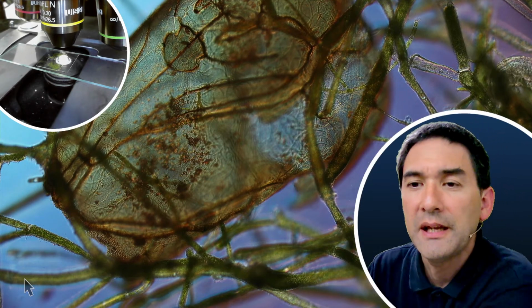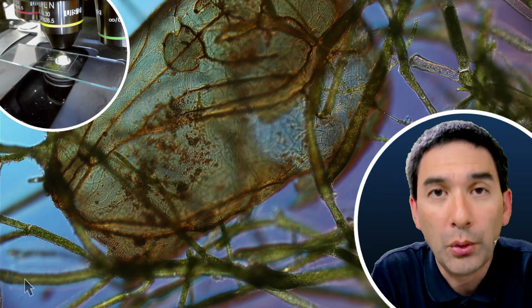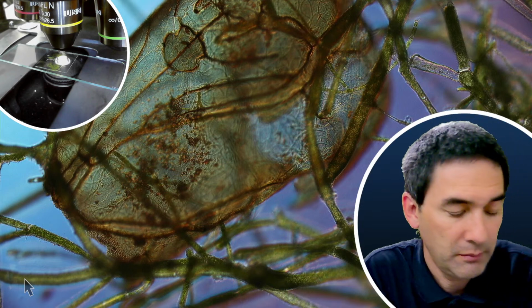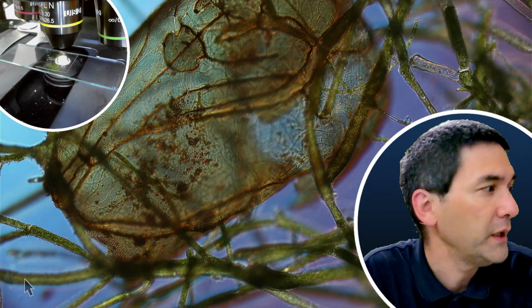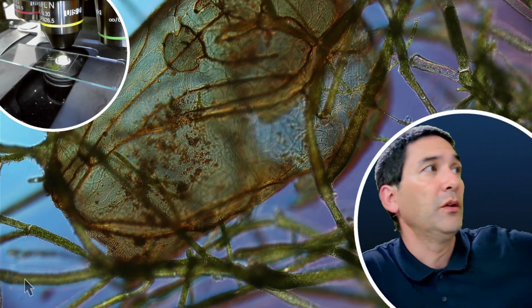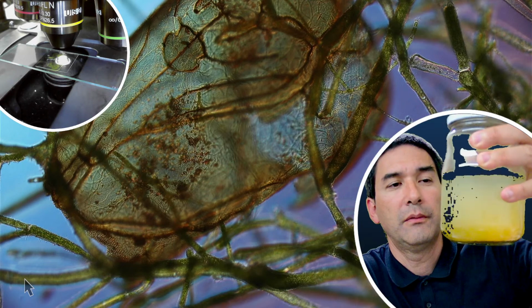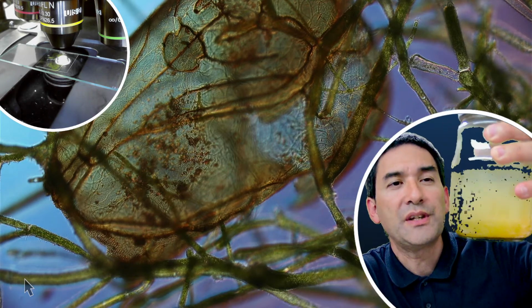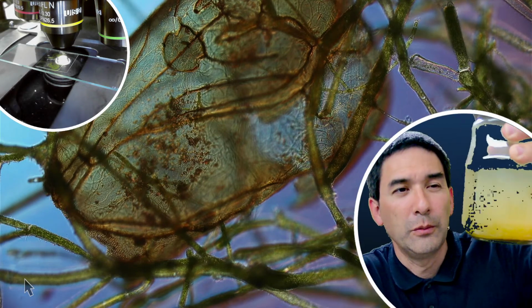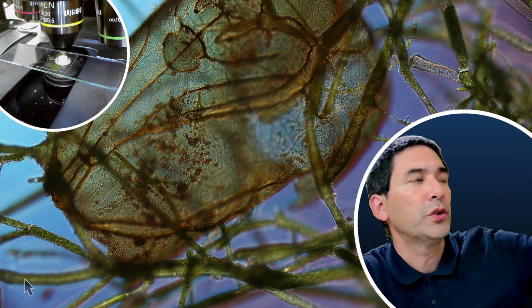Where is the best place to look for ostracods? Basically, if you've got a pond somewhere, a freshwater pond, you take some pond water and you just go for it. I've, for example, collected, this is kind of interesting here as well, this one is, I think, over 2 months old already. It's been raining and there was water standing for a couple of weeks in a little, it wasn't a pond really, almost like a puddle. And there were plenty of water fleas and water crustaceans in there.